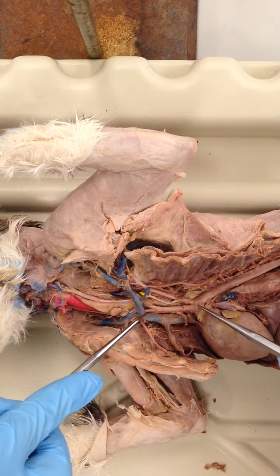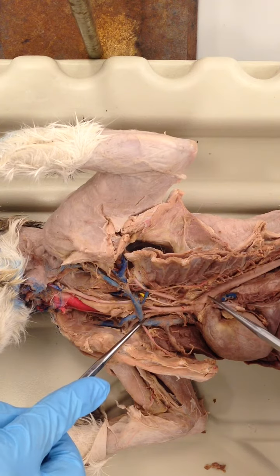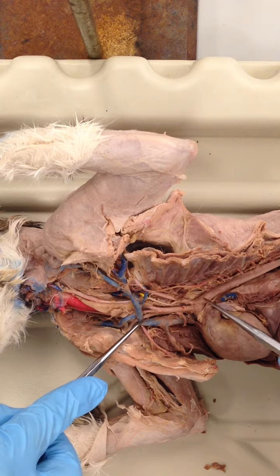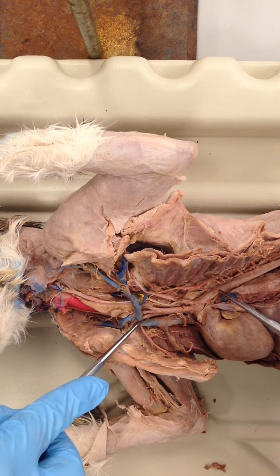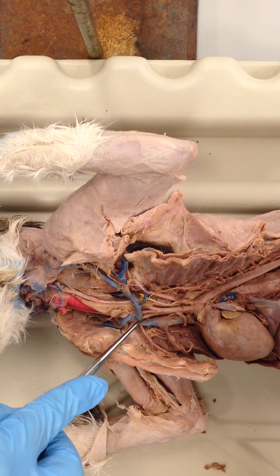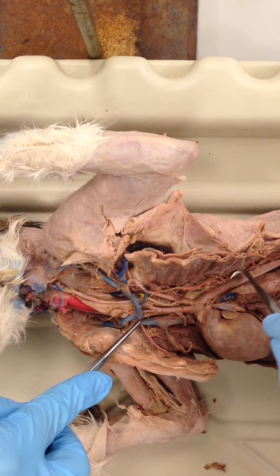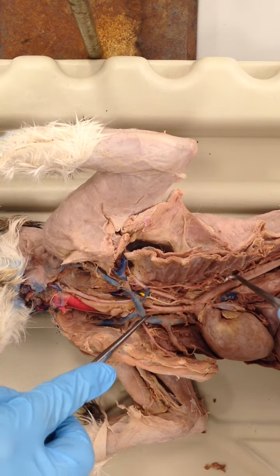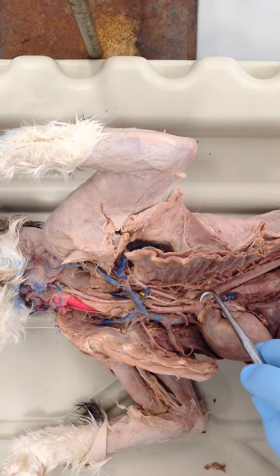Back to that aortic arch. If we follow that aortic arch around, as it starts to go back down through the thoracic cavity, this is referred to as the descending aorta. Branches of the descending aorta include these small branches that go between the ribs, and these are referred to as the intercostals, hence their location. You have several intercostals all the way down the descending aorta.